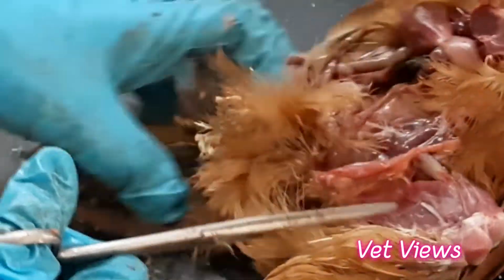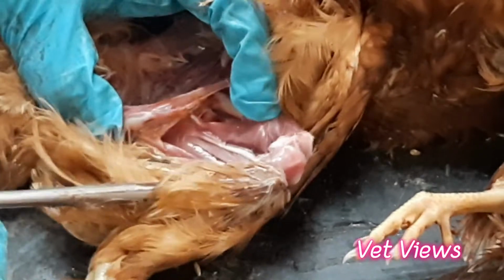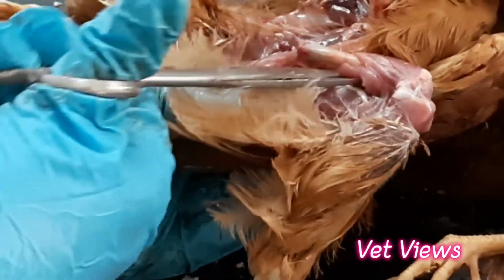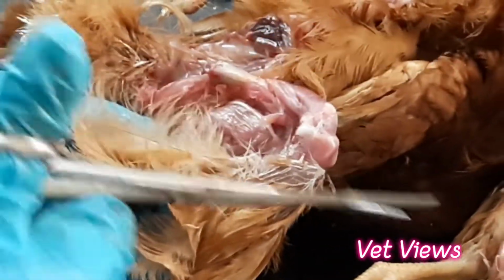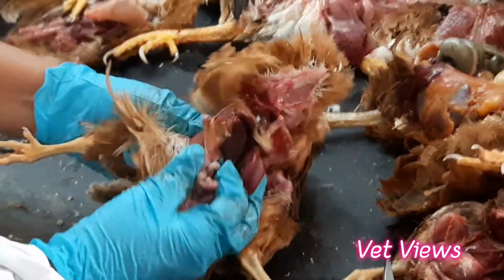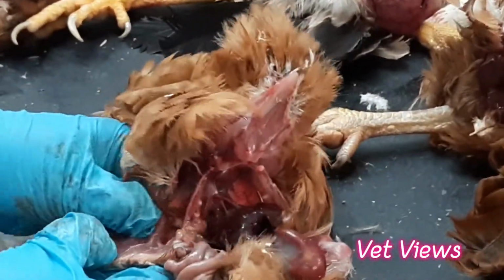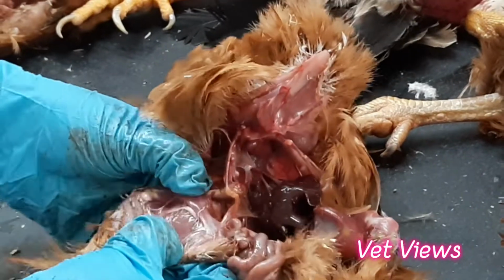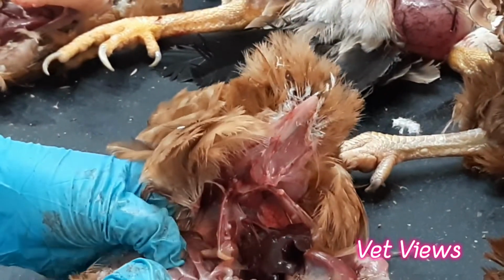In those cases, you have to examine the sciatic nerve. This is the normal size, from a bird around 6 to 8 weeks old. It should be like this, with normal thickness as well as shining. You have to see both sides. In the unilateral form, it becomes 2 to 3 times bigger than this. Now both sides are the same and normal. So that enlargement is characteristic only of the neural form of Marek's disease.